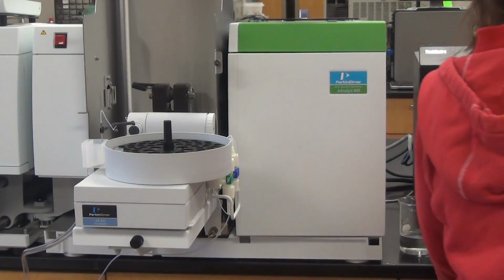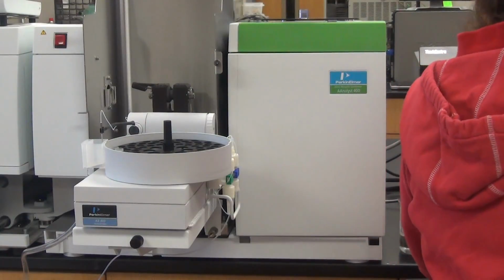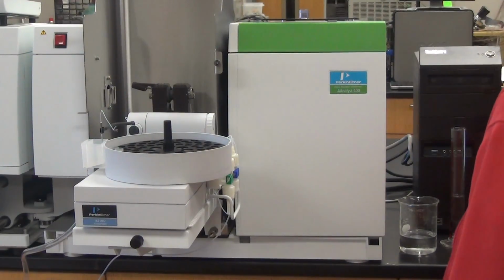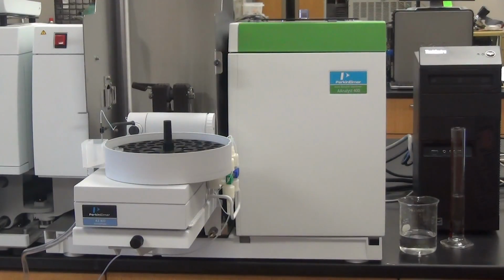So are you ready to go back to flame, or do you want to leave it up to furnace? Well, what else? That's it. Alright, so we've done everything. Now, the percent RSD was higher, that was crap. Is that what we expect? No.